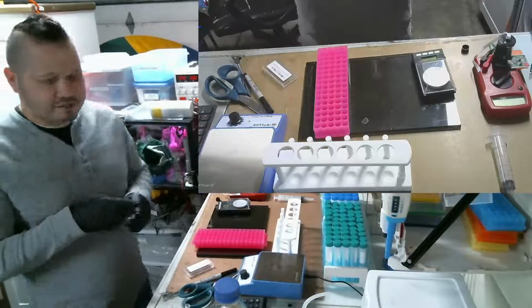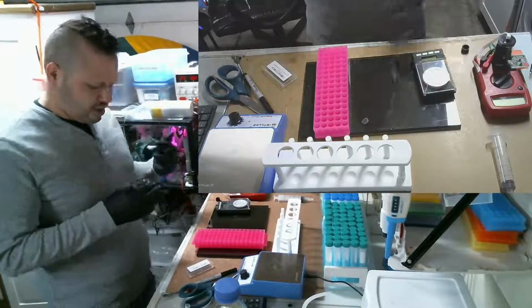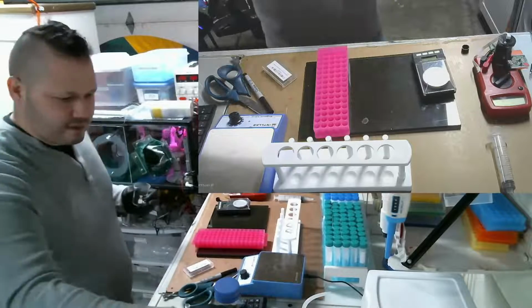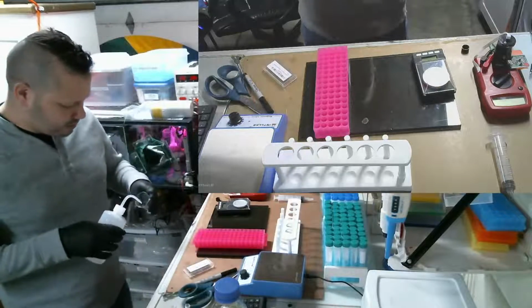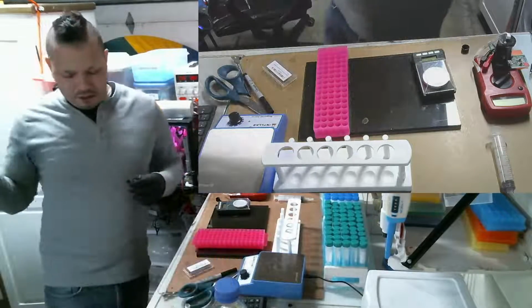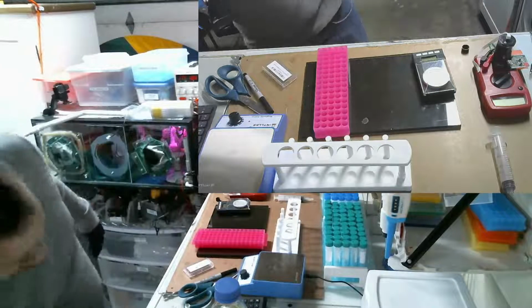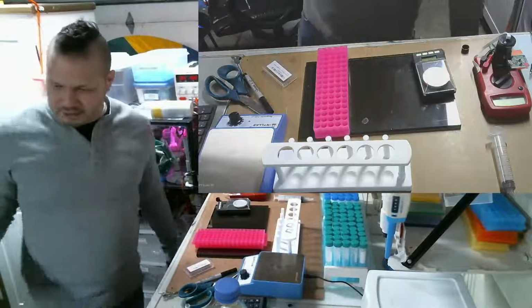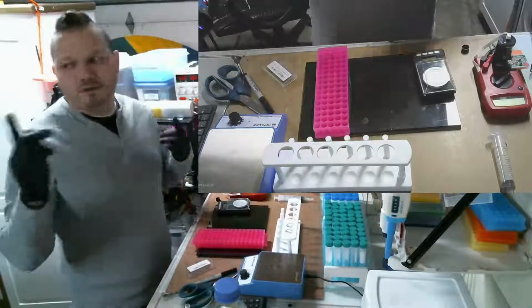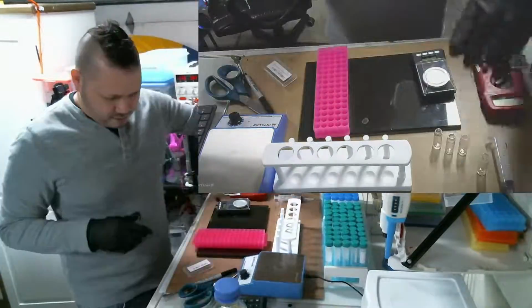Now it's funny, because I was lucky: my timer is off by an hour now that the daylight savings time thing is around. So I was able to stay up till 10 in here with light, but at 10 o'clock all the lights shut off to not mess with the algae. And so I was sitting here calculating in the dark for another hour or so on the computer, and then I moved out into the kitchen to do all my notebook work. So that was my night.